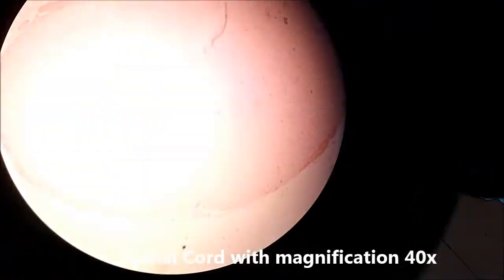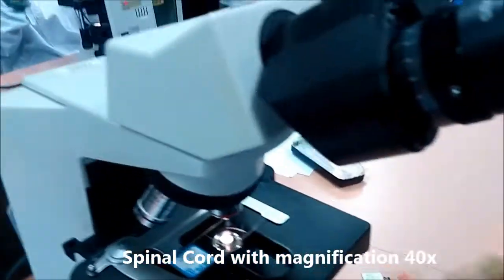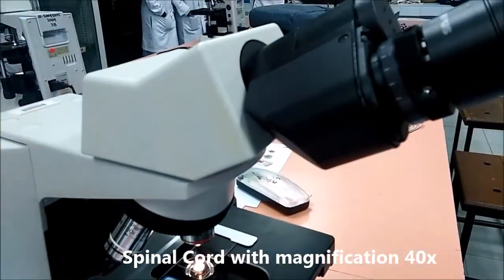So here, as we can see, this is the spinal cord, in the magnification of 40 times.